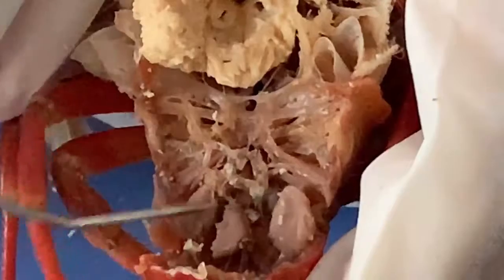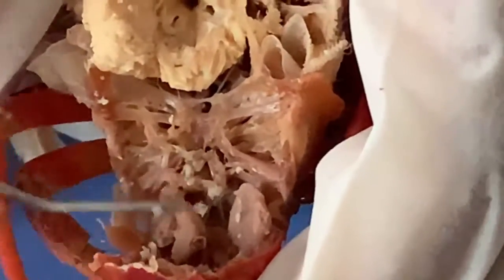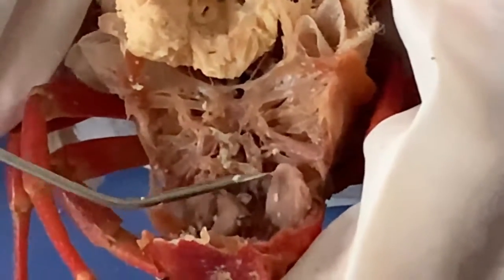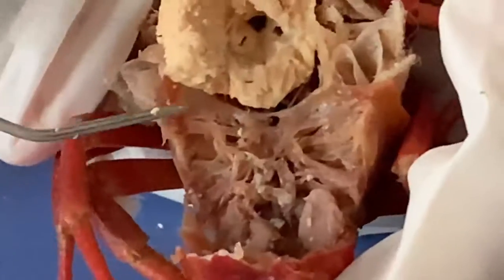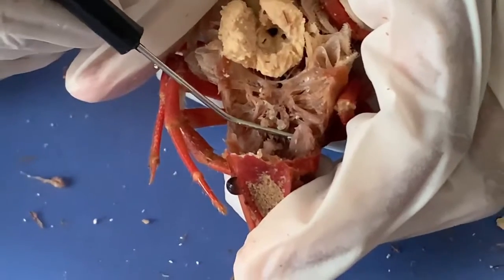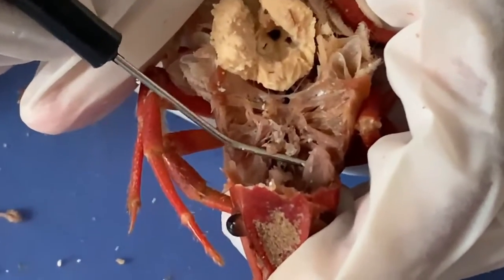When we come back to the brain, we see glands here — kind of shaped like leaves. These are called the antennal glands. They are named antennal glands because they are near the antenna. Antennal glands are basically kidneys — they remove metabolic waste and excess water.